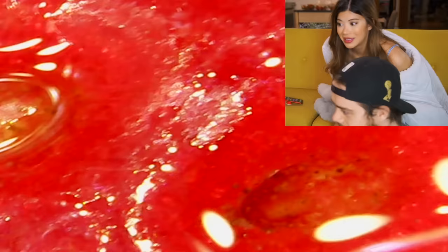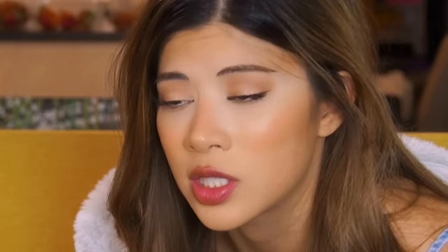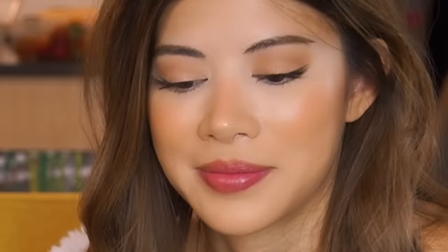Might just be dirt. I'm looking for like a seed-sized bug. I don't think you'll find a seed-sized bug — I think you're gonna find like a microorganism. Clean — maybe this TikTok girl's thing is wrong and what you've got to do is just put a ton of salt in some water and give it a go. Terry eats the strawberry. How does it taste? Tastes like vinegar — you're supposed to rinse it. That's like taking a bite out of your bath water. The camera guy comes on camera and then he eats bugs.